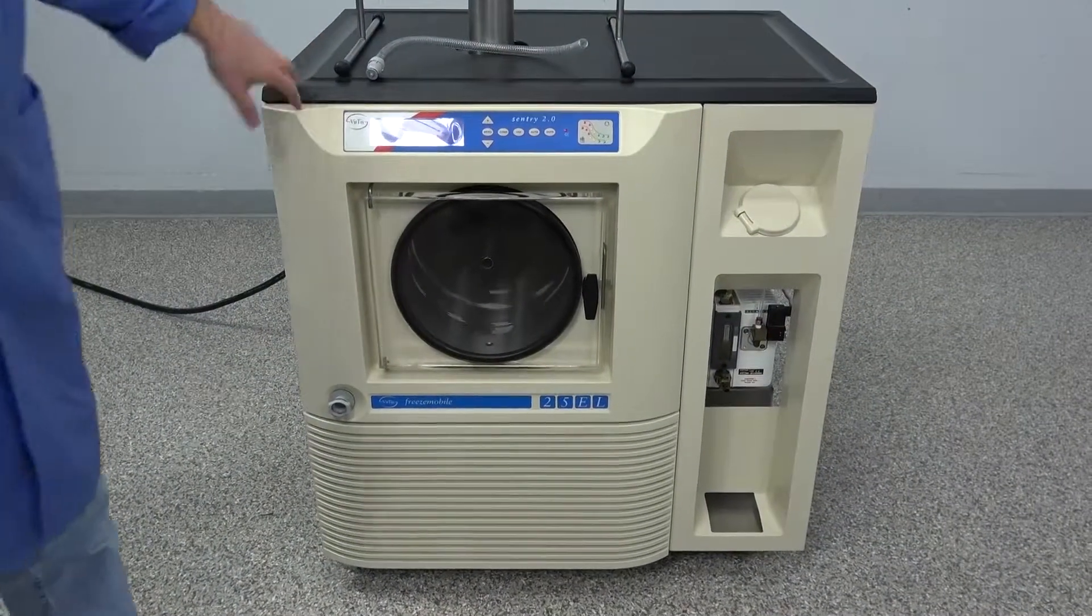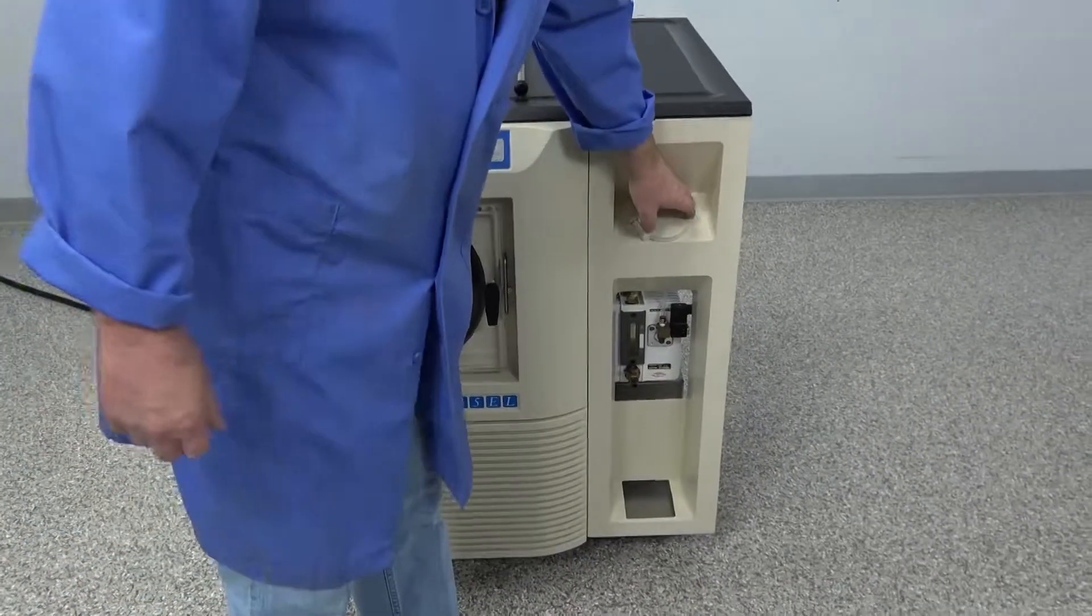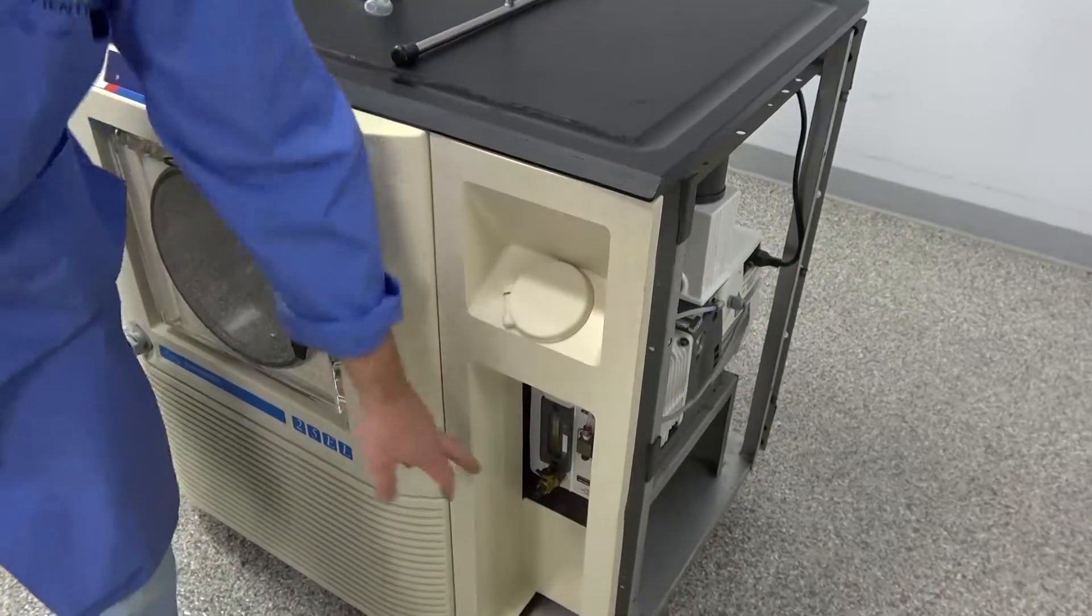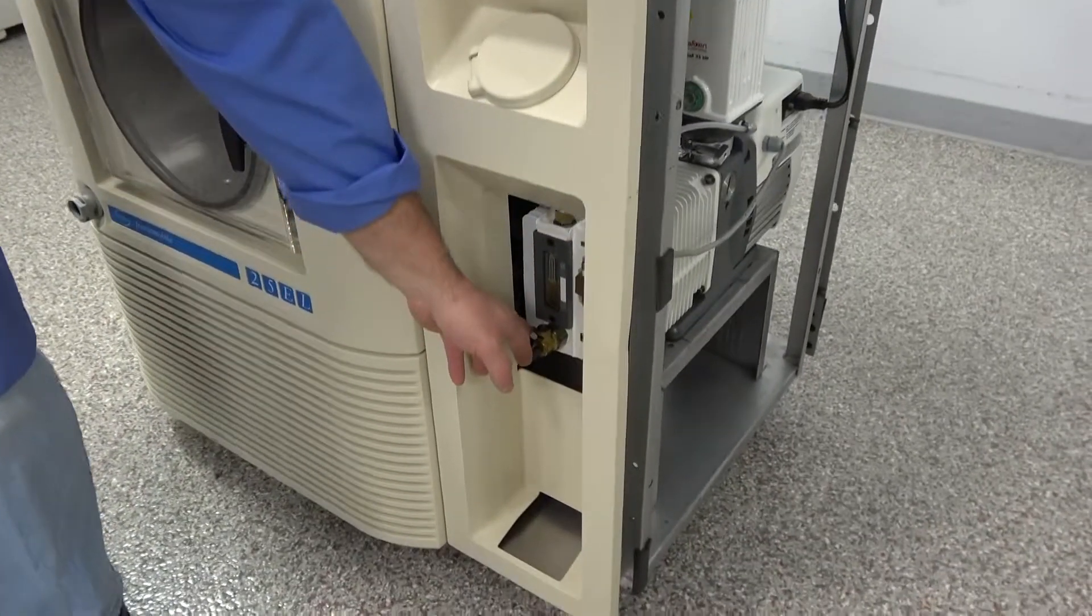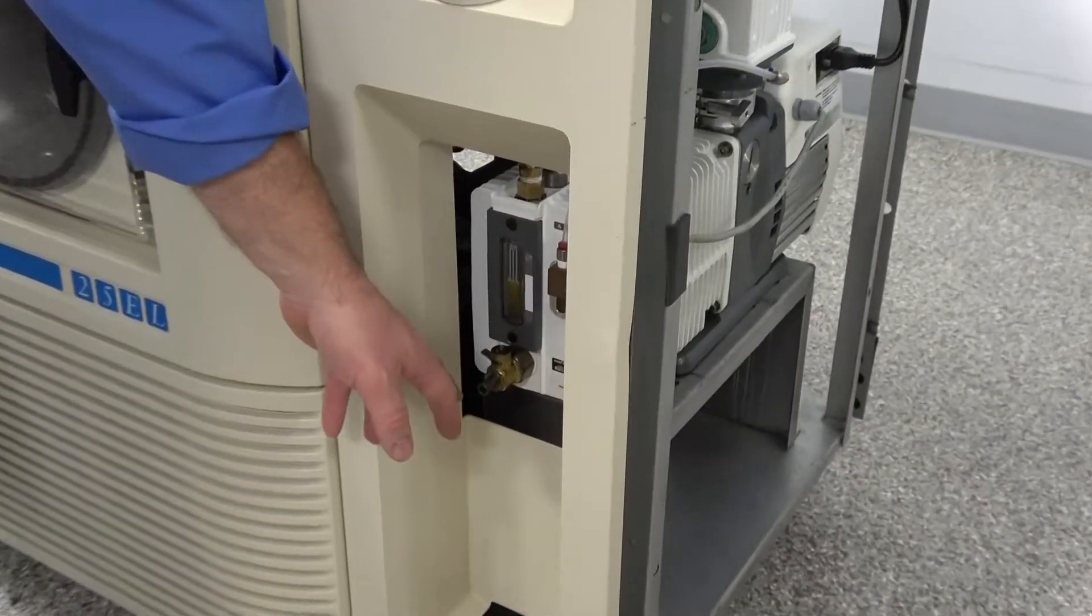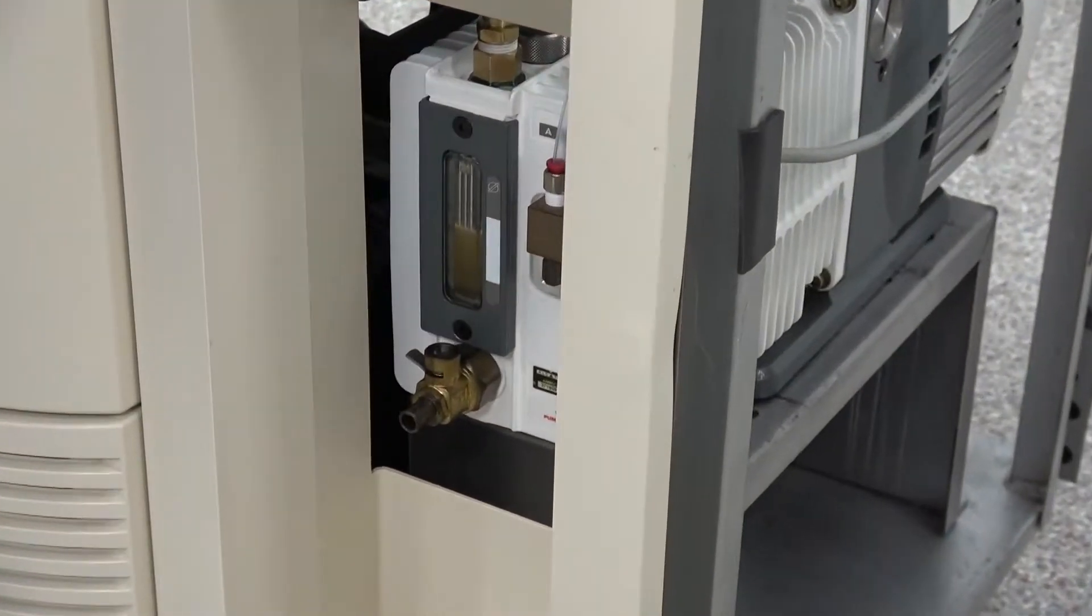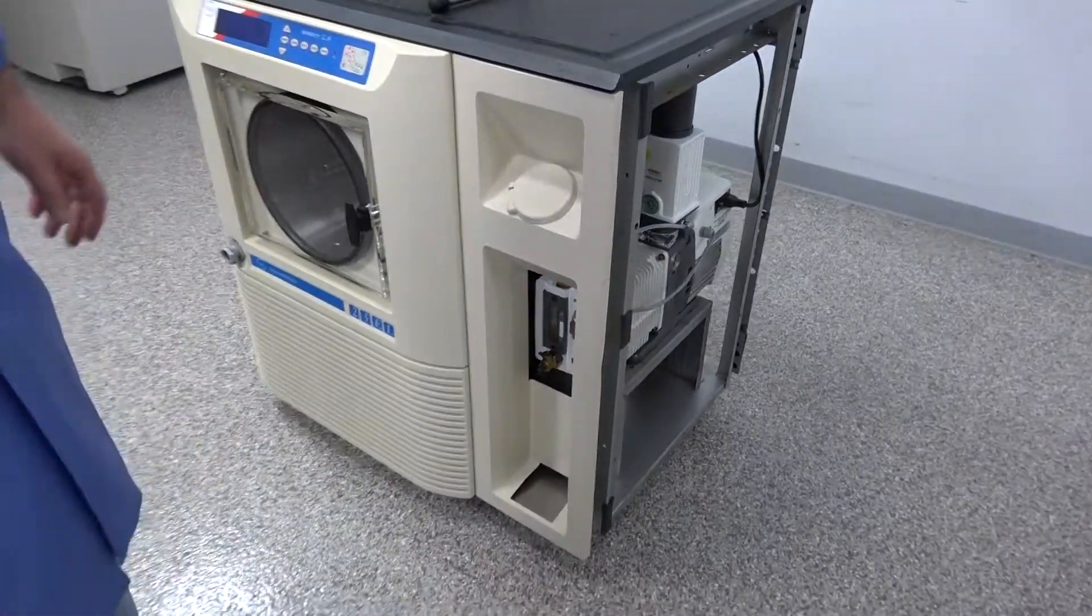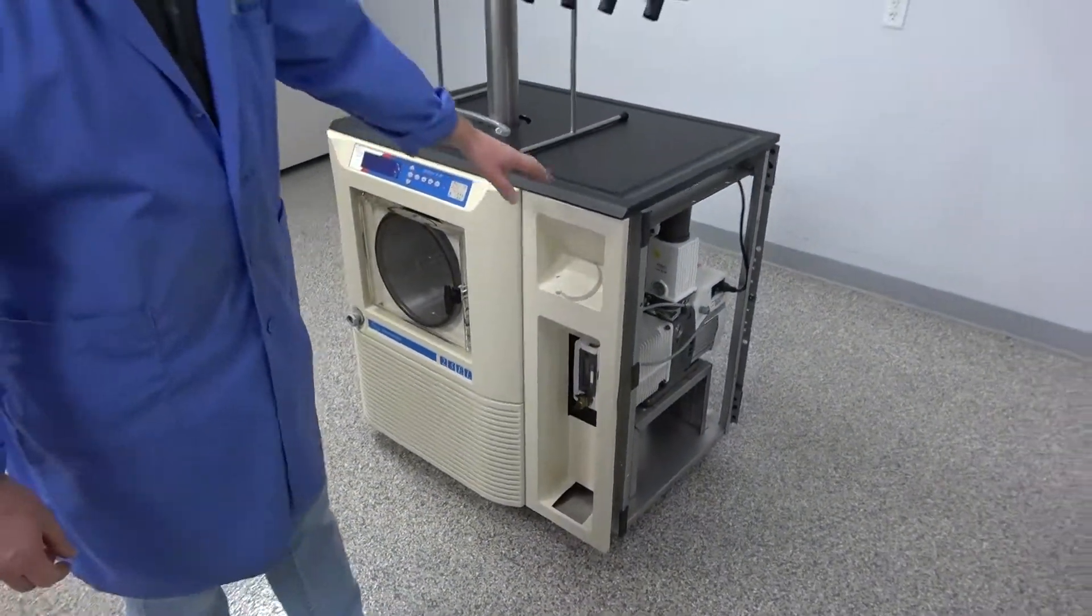And then we're going to move over here again to this. This comes with the quick refill when you're changing your oil. Down here you can see it's just a quick valve. Drain your oil out, turn it, shut it back off, and refill it very easy here for those of you that are continually changing the oil for contamination purposes.